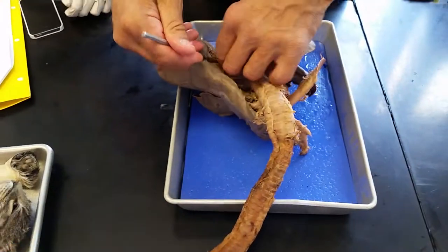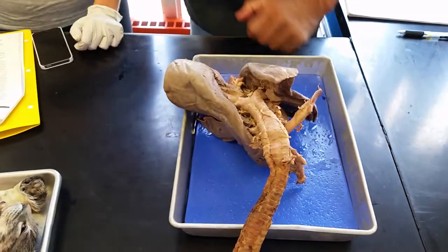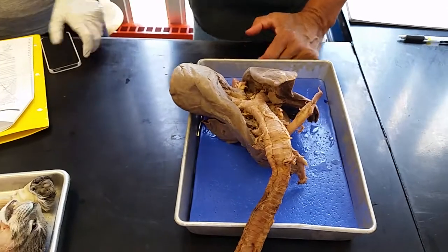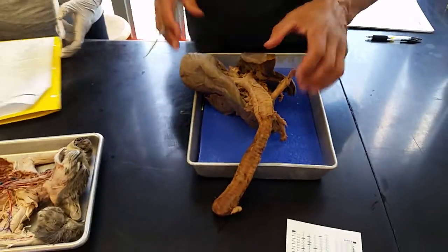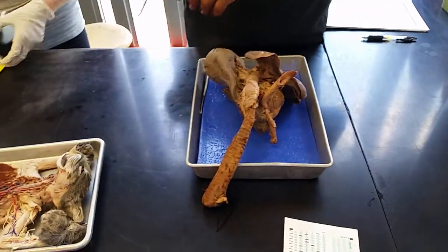This is the vein. You can feel the difference — it's thin like tissue. So you can't be afraid to touch it. You should be putting gloves on. You can't do this with no gloves.